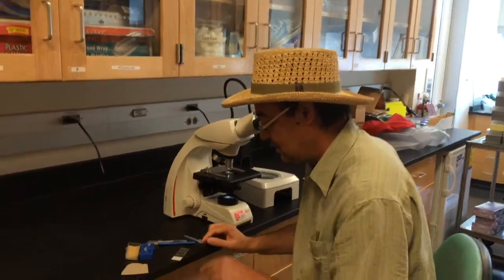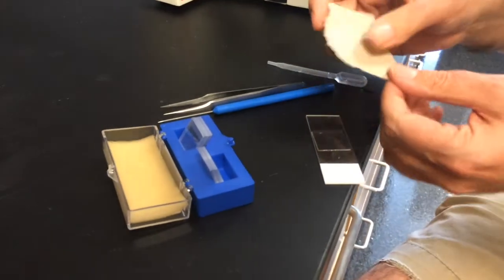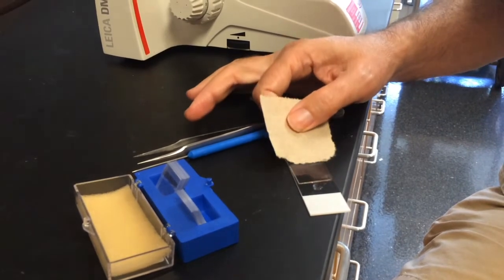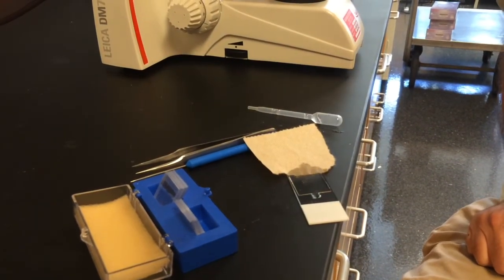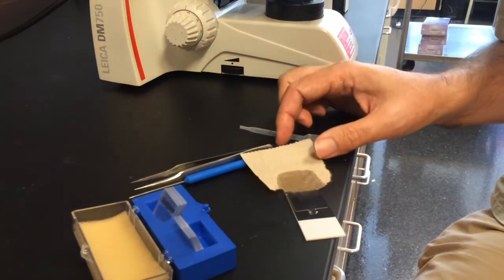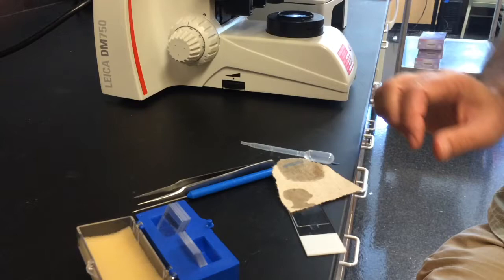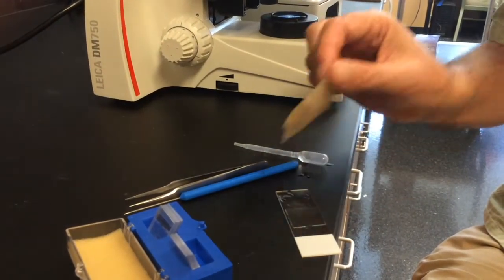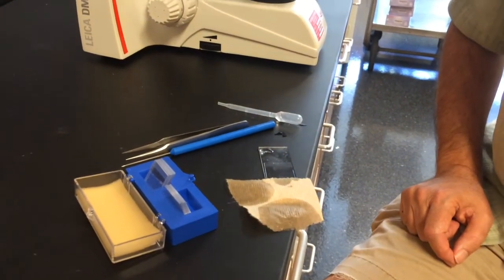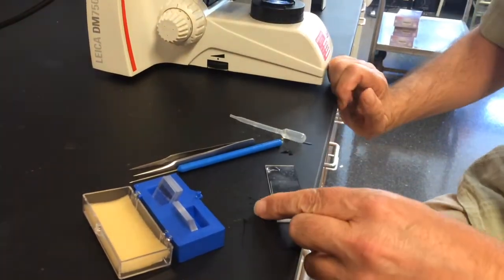Okay, so sometimes you have too much liquid under the cover slip, and this can be fixed using a piece of paper towel here. You want to get the little bits of liquid off the top of the cover slip, definitely, like that. And then you can just put the edge of the cover slip there and mop up all that extra liquid. We definitely don't want any methyl cellulose getting onto the microscope, or even any water. And then here, get the rest. And then maybe some from this side. That's probably good enough. So see, there's no water around the edge of the cover slip.